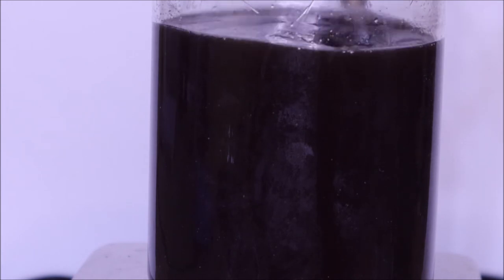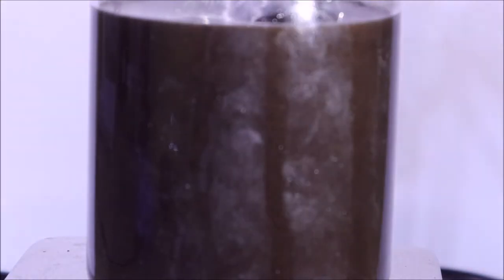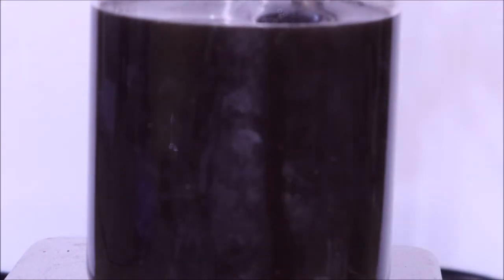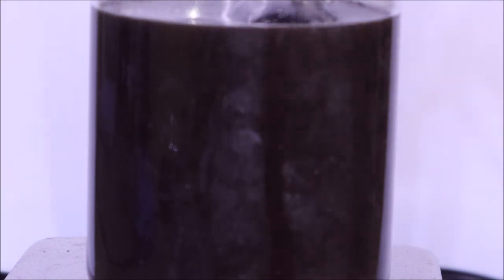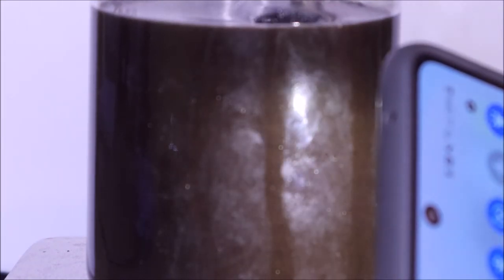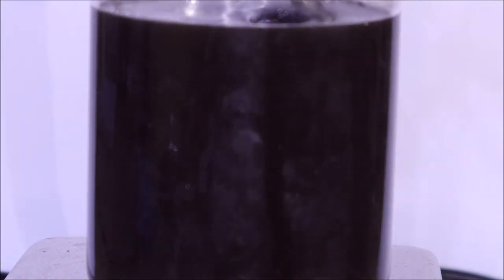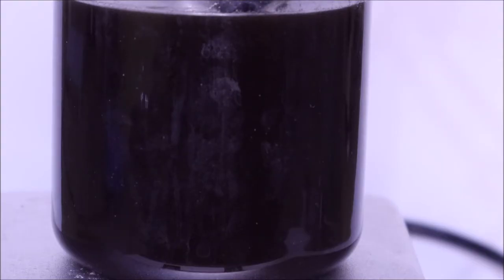After a couple hours, I noticed that the hair actually wasn't together anymore. I couldn't actually grab any of the pieces. When I shine light you can still see there's some particles moving inside there, but it's not hair anymore. I don't really know what to describe it at this point. It's probably just kind of short polymers. It's hard to tell right now because it's a pretty dark solution.